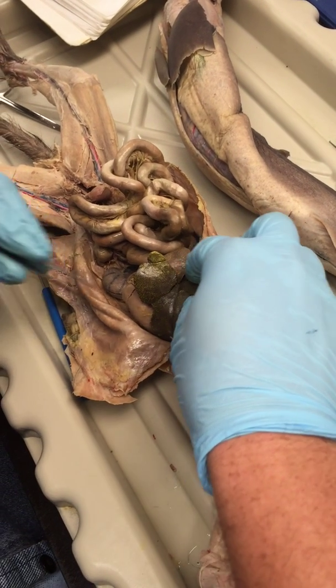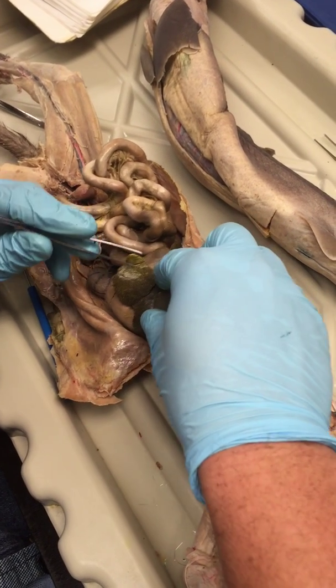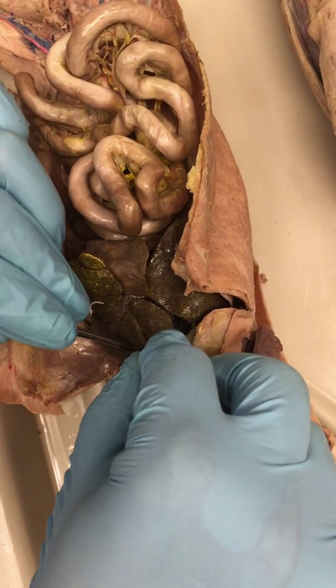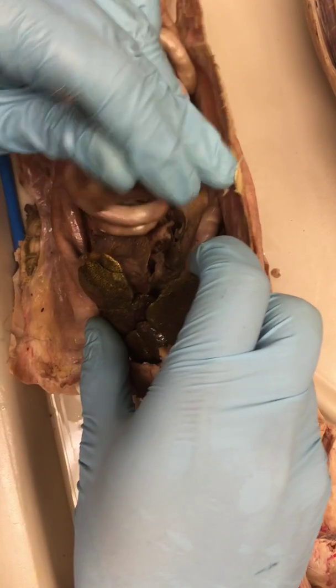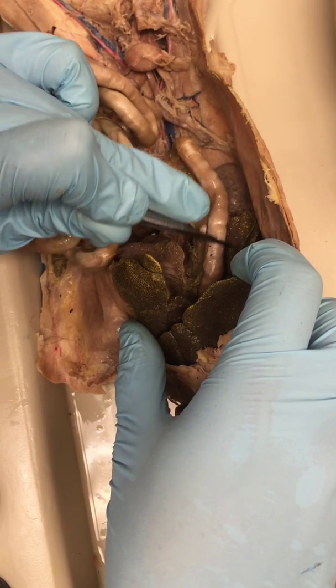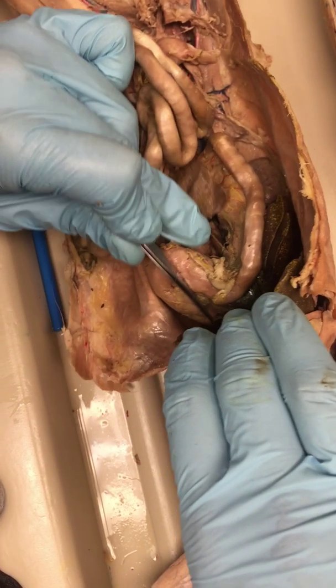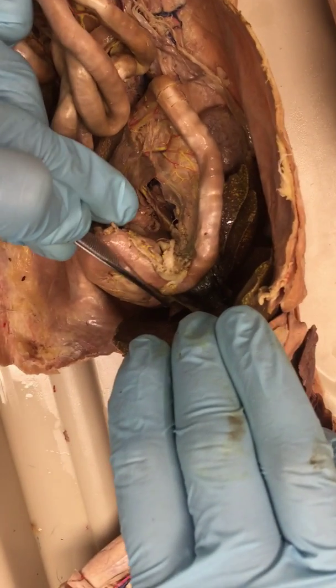With the organs, let's start with this big old gray thing, the liver. This is the left lateral, left medial, right lateral. It's a double-headed one underneath. And then the caudate lobe of the liver. So it has 5 lobes, and there is the caudate lobe right there.